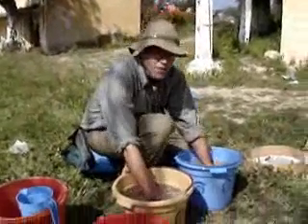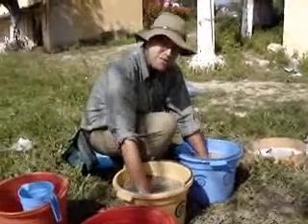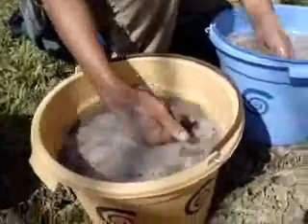The idea is to free your charcoal from your archaeological sediment. This is perhaps the most intimate you'll ever get with your archaeological site, as you make an effort to break down and loosen up the clods, the mud, the sand, and to bring forth your archaeobotanical sample. As you can see, lots of bits of black — lots of bits of charcoal — will float to the surface.